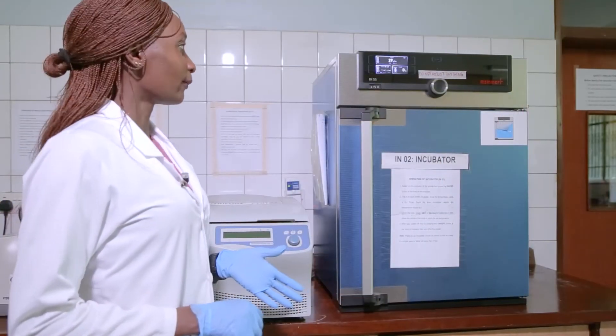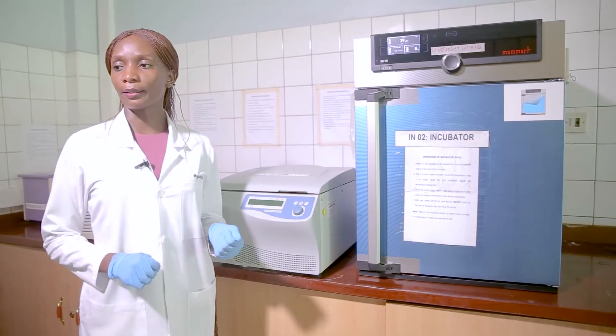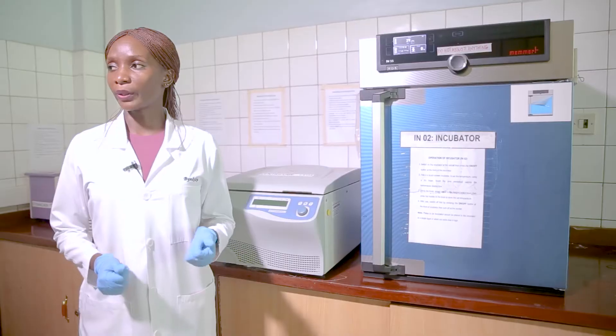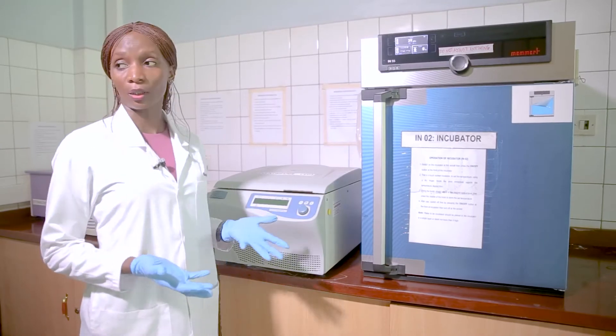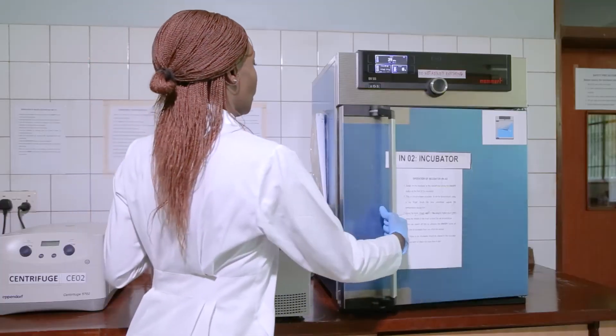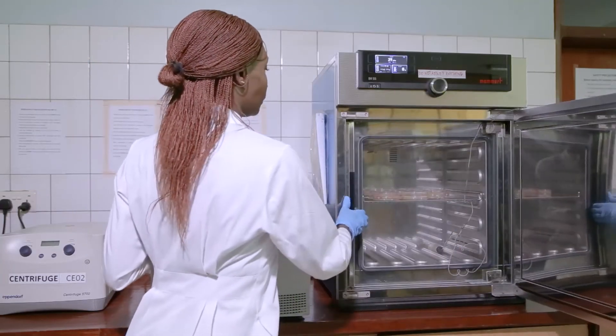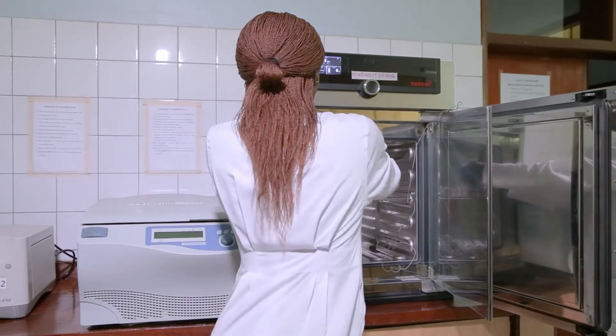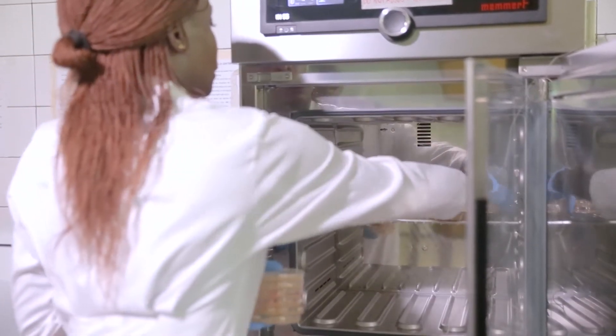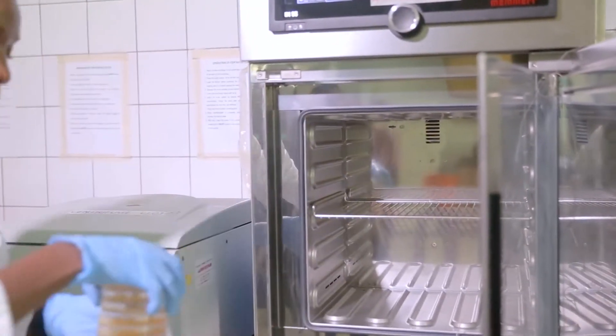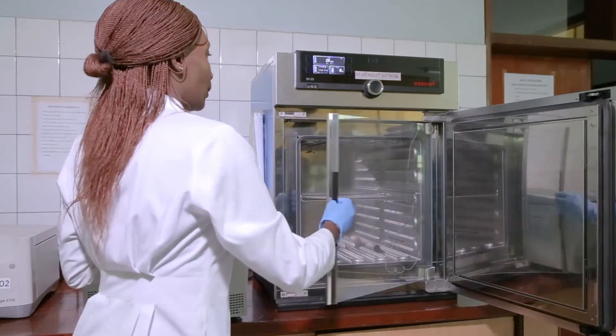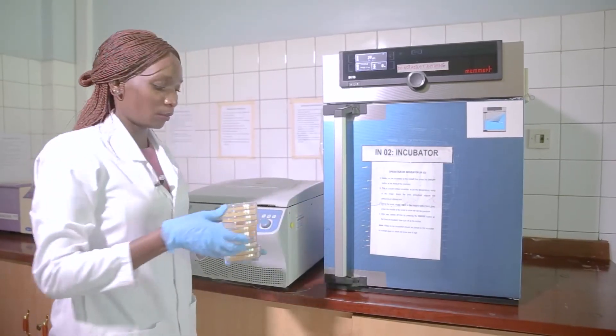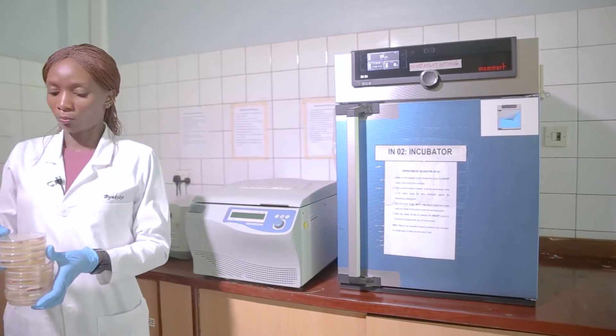So after three days of incubation at 30 degrees like I mentioned, the molds should have grown if they were present, and that's what we are going to check and see. We will carefully remove them from the incubator.